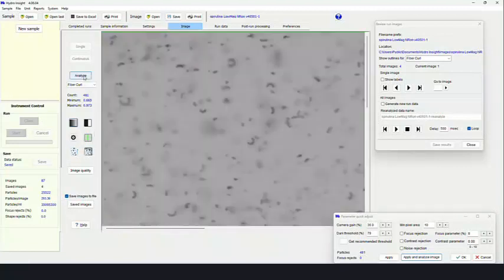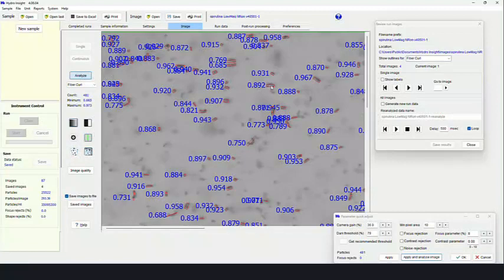Zoom in a little bit. You'll see a straight particle might give you something like a 0.91, closer to 1, but as the particles become less and less straight, the number will move away. What's really useful with this measurement is to be able to determine, for example, in this case, maybe the curved samples are the ones that are of more interest. We can actually look at the statistical histogram and differentiate what percentage were curved and which ones were not curved. So that's a useful example.